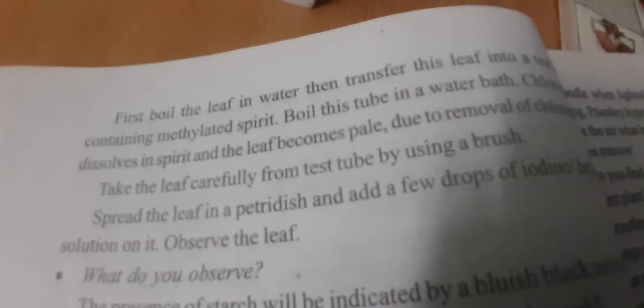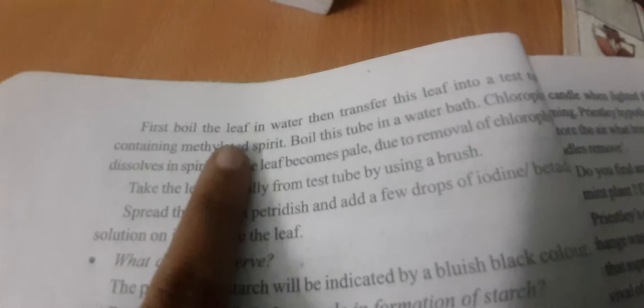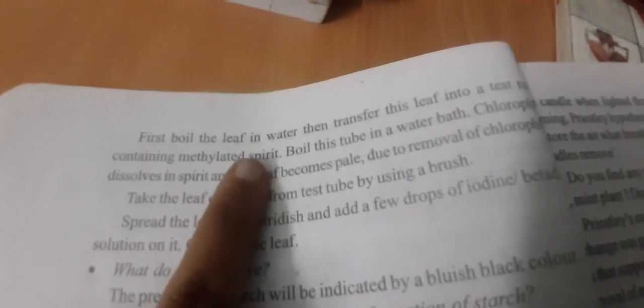First, boil the leaf in water, then transfer the leaf into a test tube containing methylated spirit. After that, boil this tube in a water bath so that the chlorophyll dissolves in the spirit.